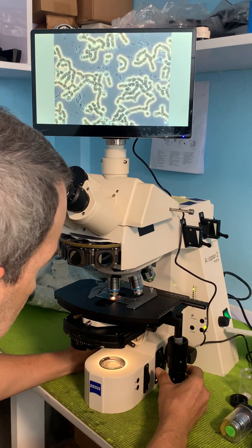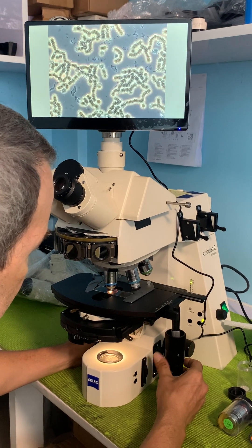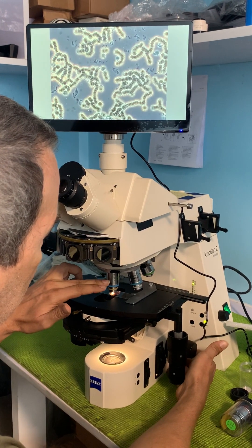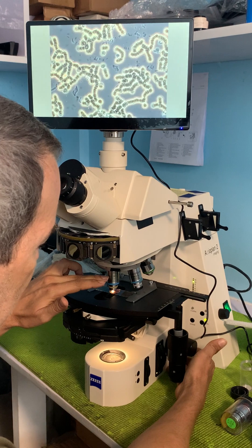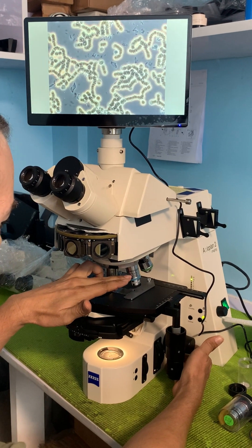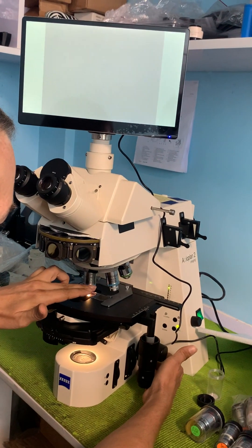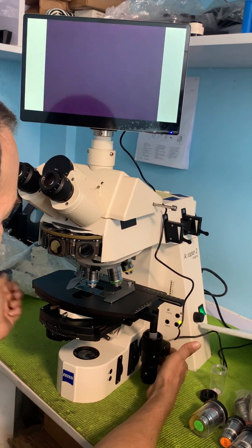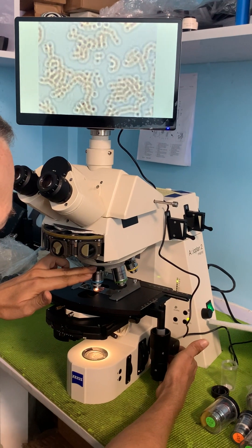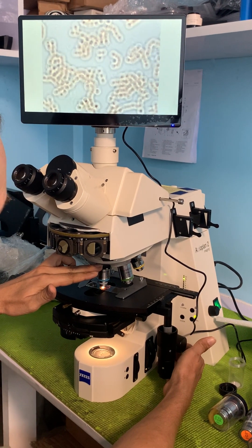Now let's compare this with DIC. I'm going to take it off my phase objective, and I'm going to go to a Plan NeoFluar 40X objective that is not phase contrast. And I already have my DIC prism in place.